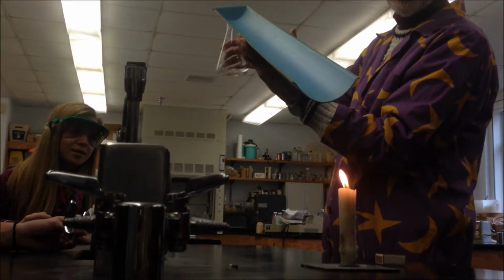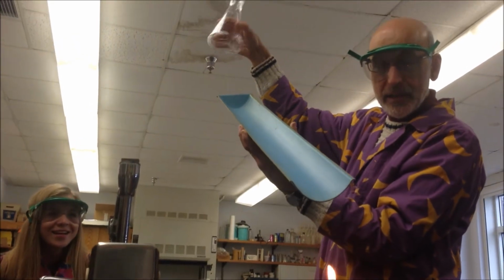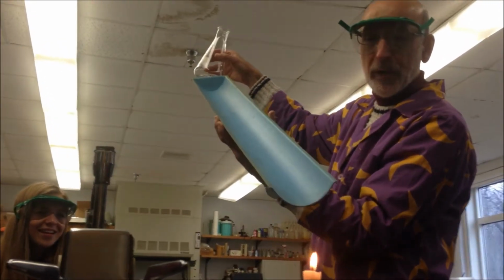So what does that tell you? Deanna said, I see the gas going down. What does that tell you? Right, exactly. The vapor that this liquid produces is denser than air. There's actually a real simple way to figure that out.